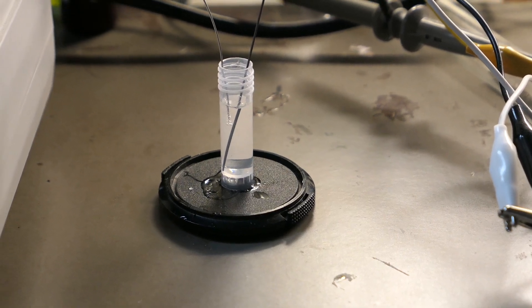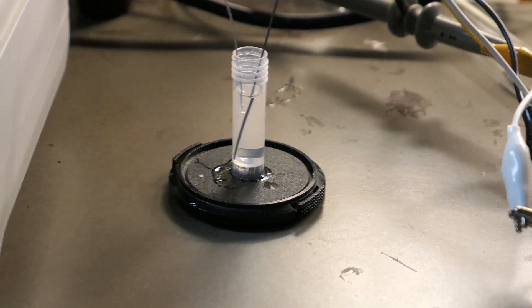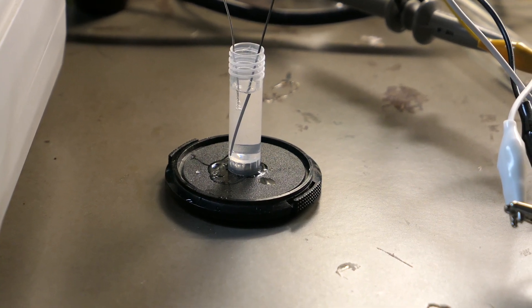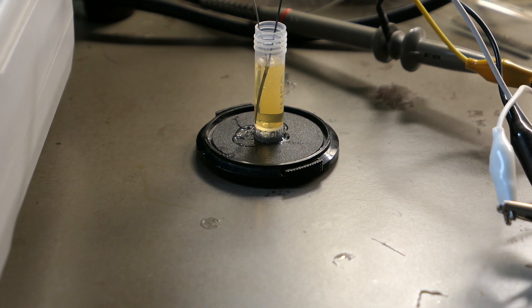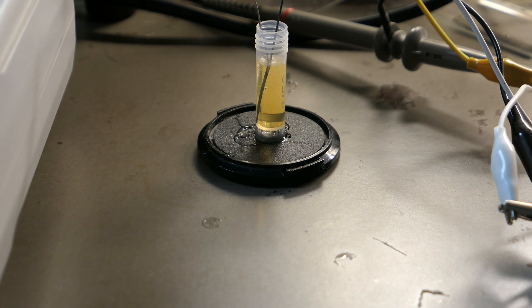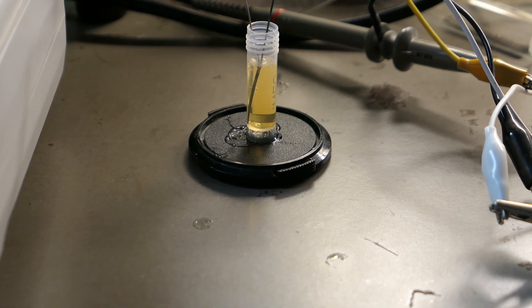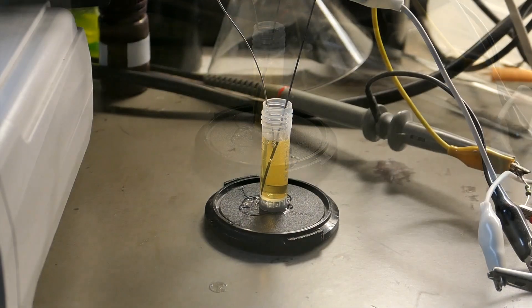The system works and the electrolysis has begun. With a few bubbles forming, platinum will oxidize and dissolve as hexachloroplatinic acid. After just a few minutes the solution starts to turn slightly yellow, then increasingly so over the hours.